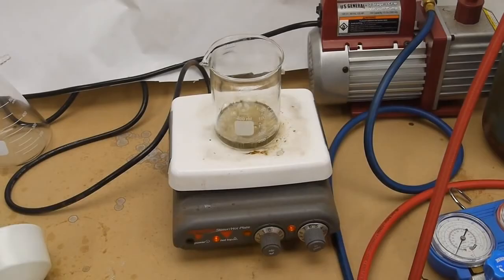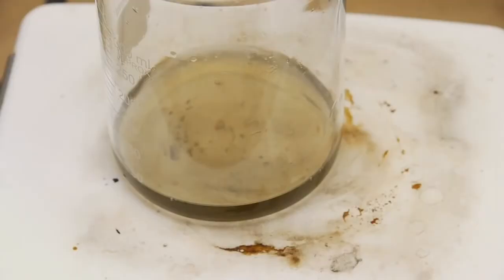Now we want to get rid of the hexane, so all we have to do is boil it away. The oil has a much higher boiling point than hexane, so we have a wide window where we can heat it up and just let all the hexane boil away. The temperature is 150 degrees C, so we can be sure that any hexane has been boiled away by now and the boiling has visibly stopped.